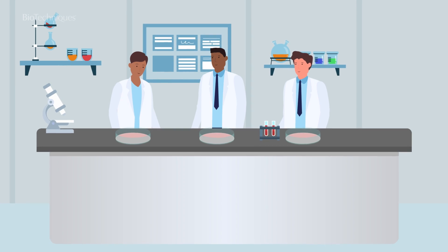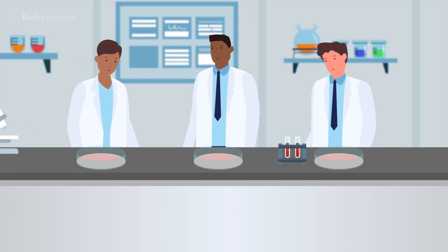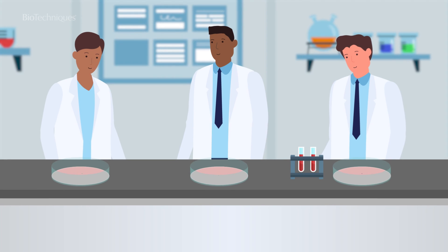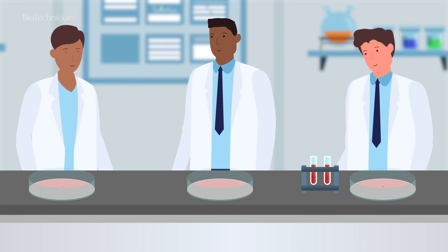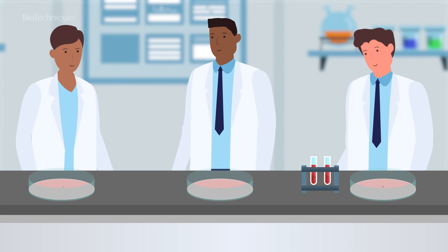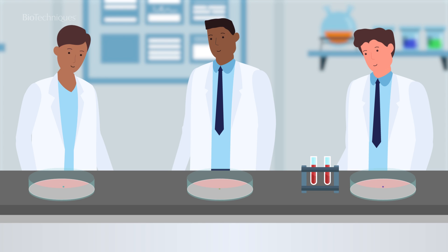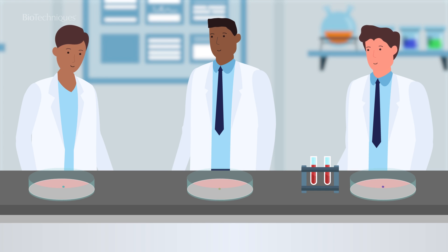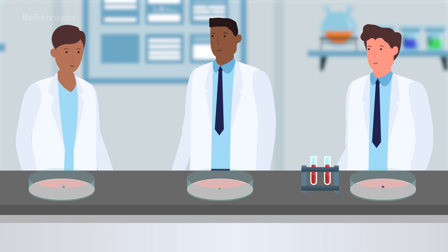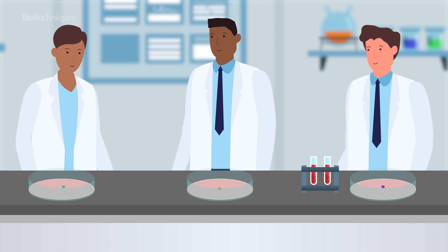Although the use of 3D cell cultures is growing, reproducibility remains an issue in the field. One reason for this is that preparing 3D cell cultures can be technically challenging, so the cultures are prone to variability.